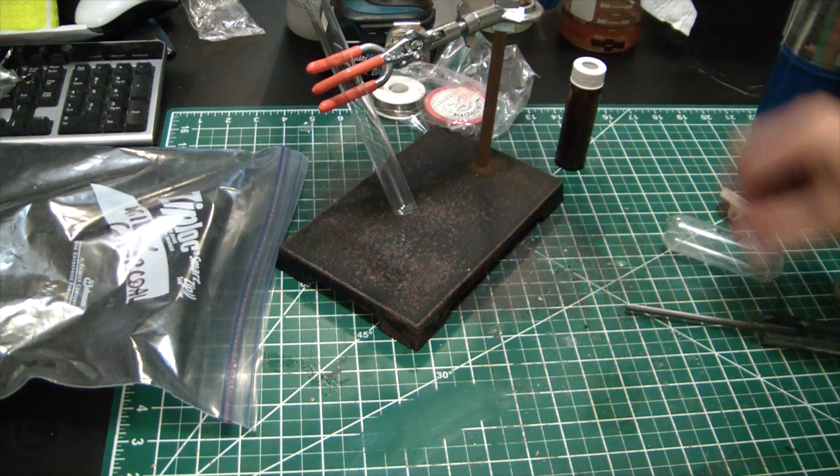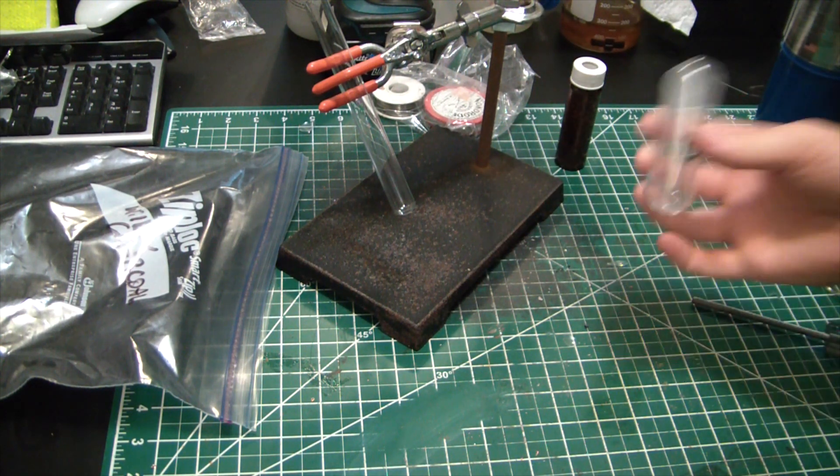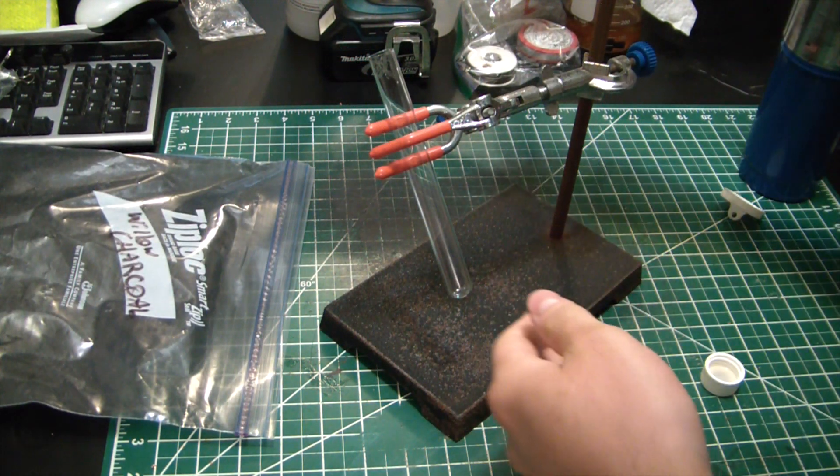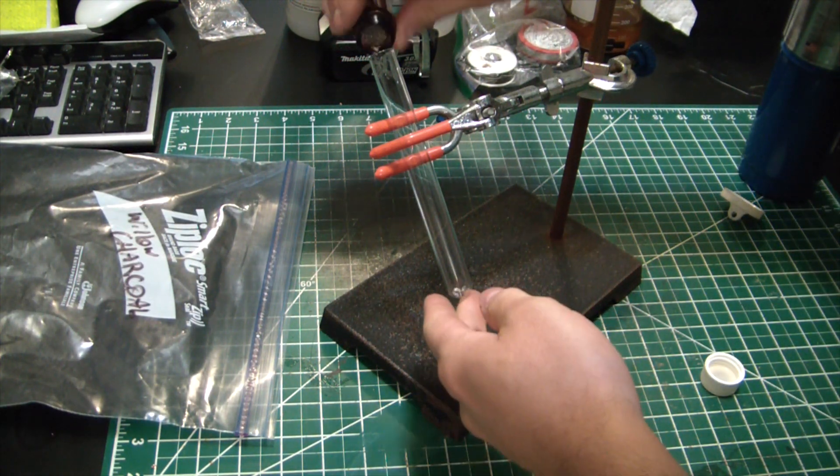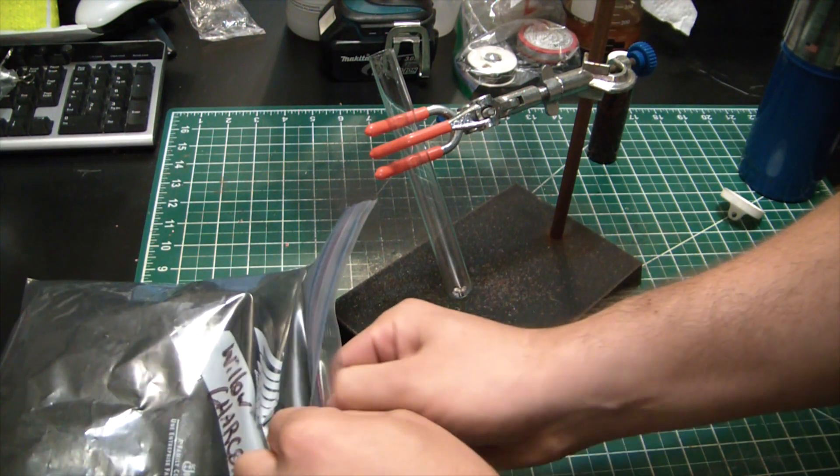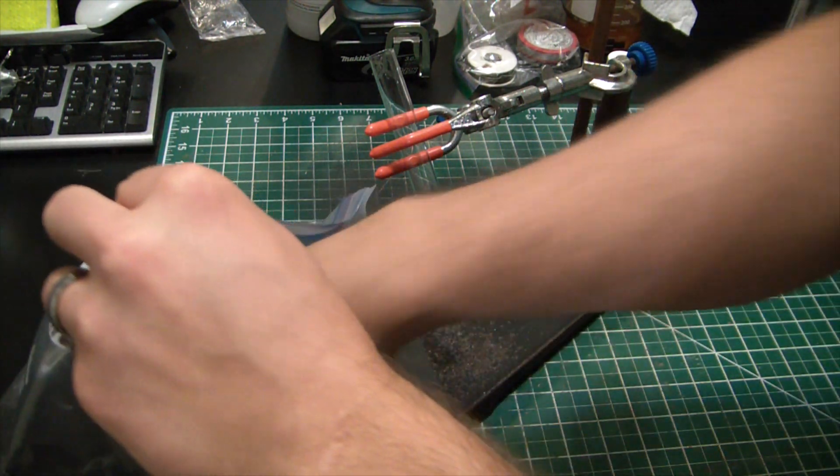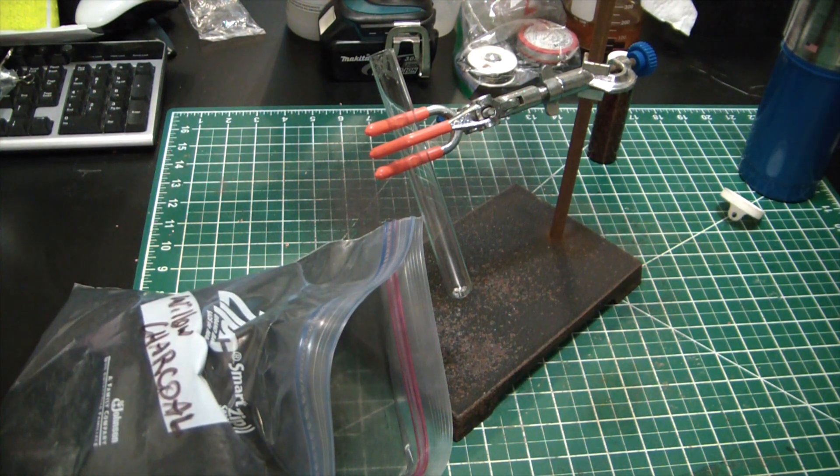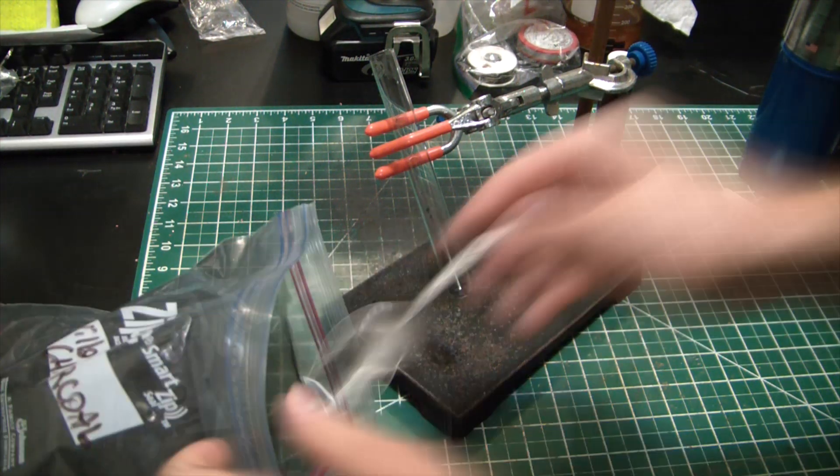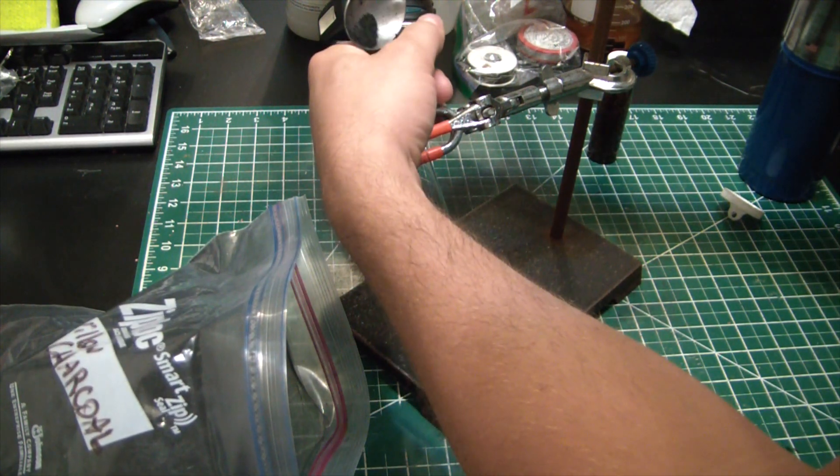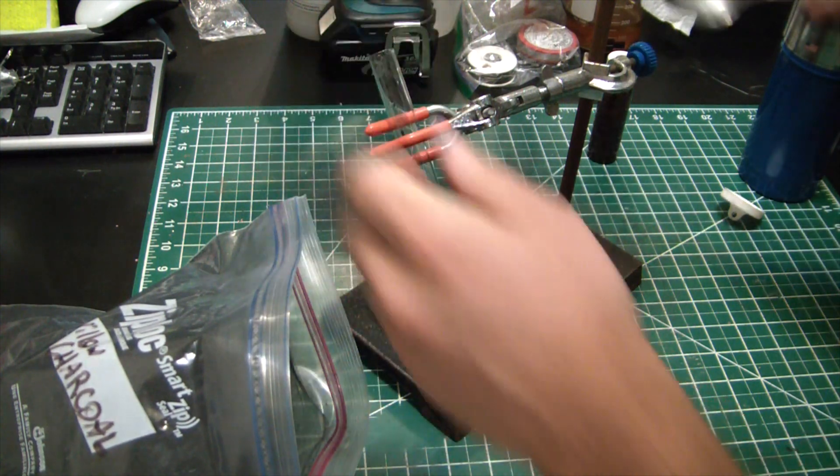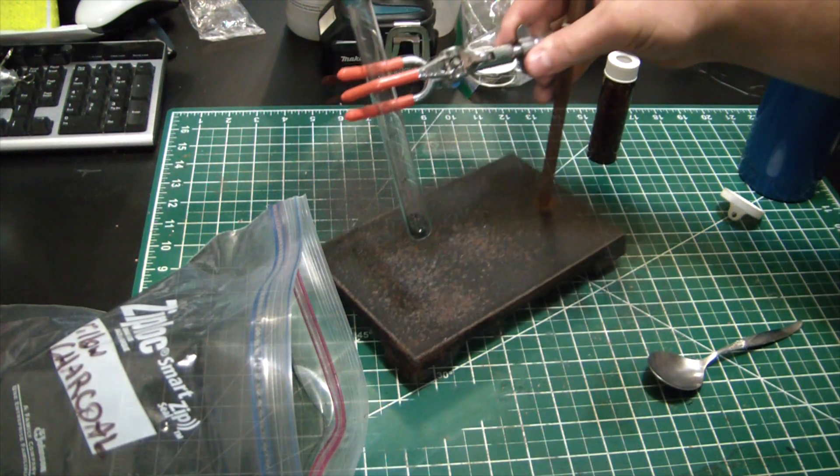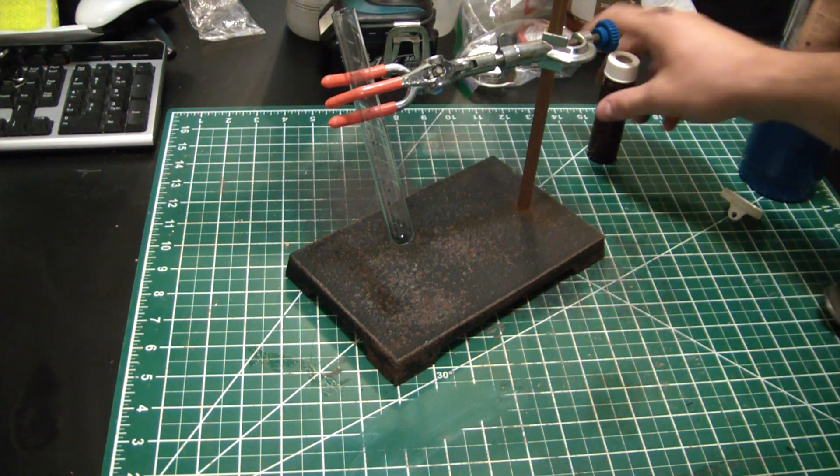Get rid of all this glass. I'm just going to put a few little grains of calcium in here and then get some charcoal. Trying to go for the fine powder stuff, so I need a spoon. Really need this a little better powdered, but it's as good as I got.